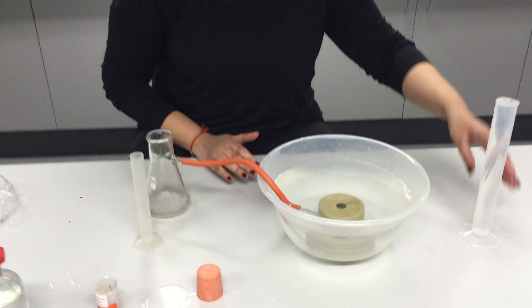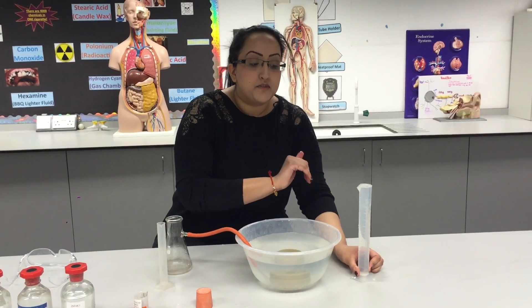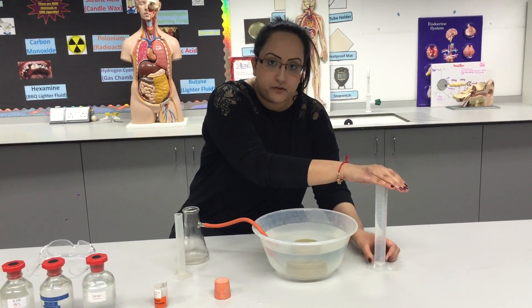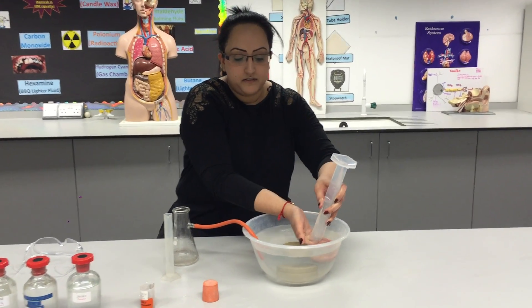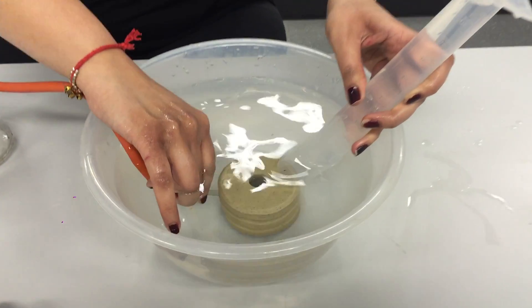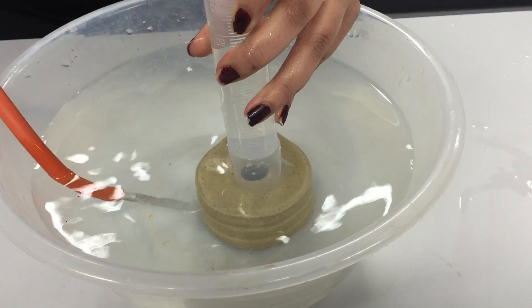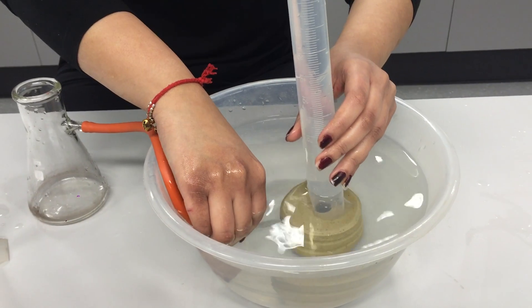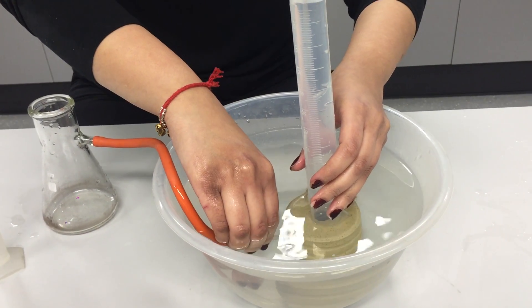You will need a 100 cm³ measuring cylinder filled to the top with water. Put your hand over it, invert it, place your hand in the water, and then put the delivery tube that's already in the water into the bottom of the measuring cylinder — it should stay nice and sturdy.